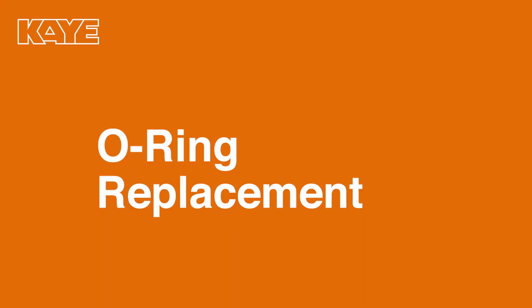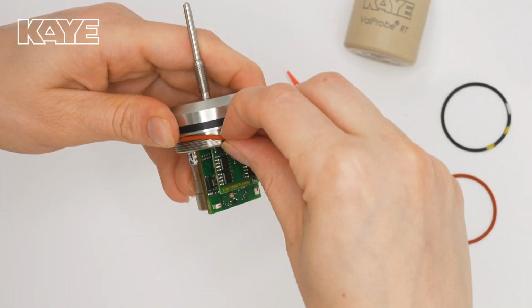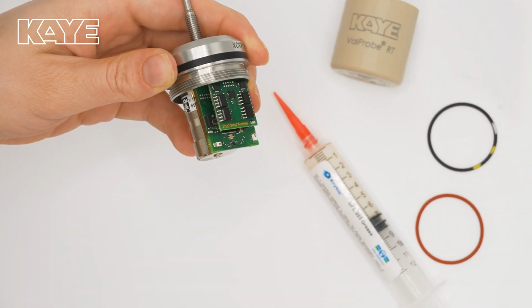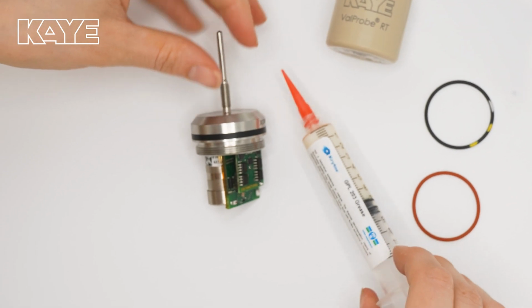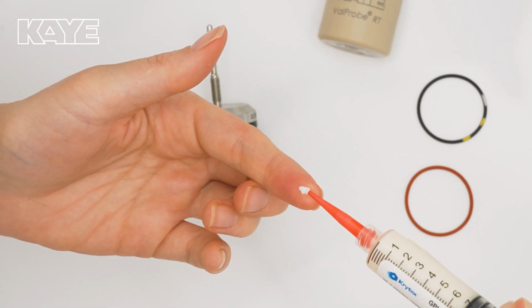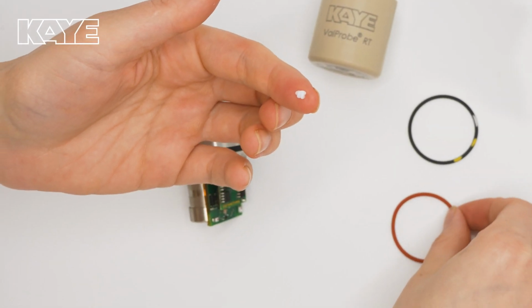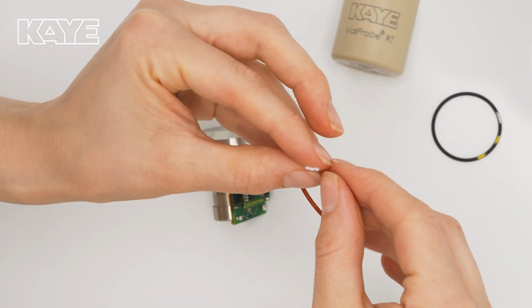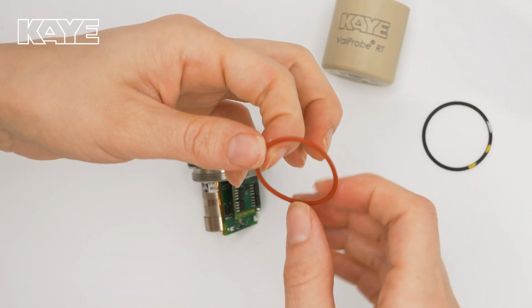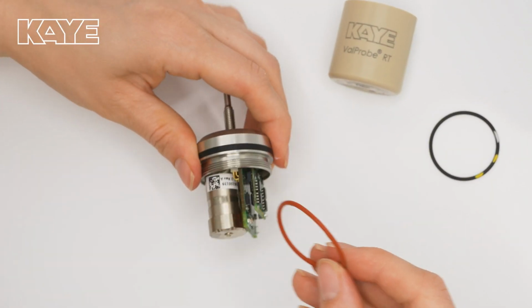Every time you replace the battery, we recommend you also replace the O-ring. Start by gently removing the old O-ring. Next, apply a small amount of Krytox sealing grease to the tip of your finger and rub it around the entire O-ring. This is an important step in ensuring that the internal components of your ValProbe are not harmed while being used. Use the red O-ring for temperature sensors and use the black O-ring for pressure sensors.